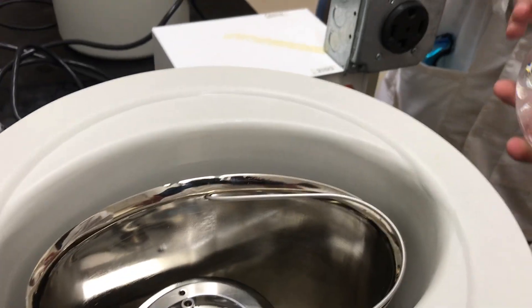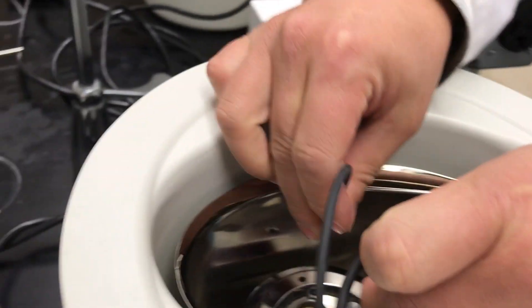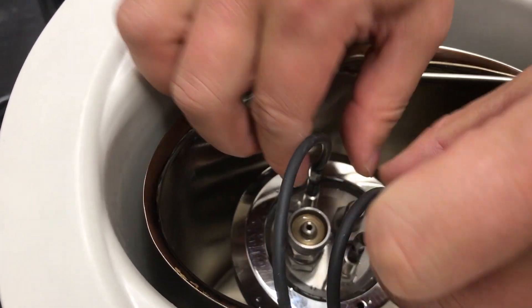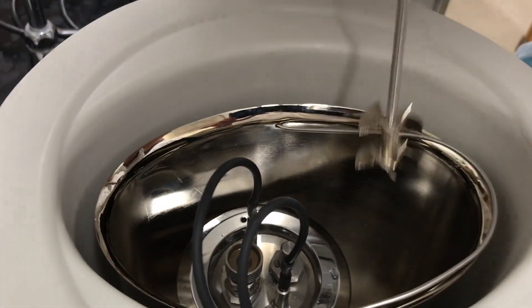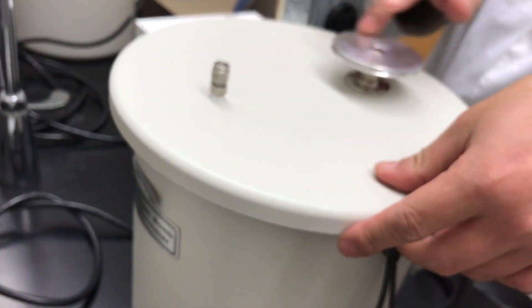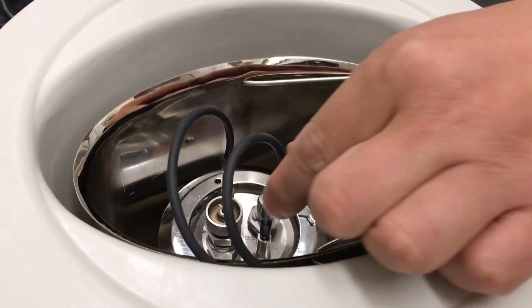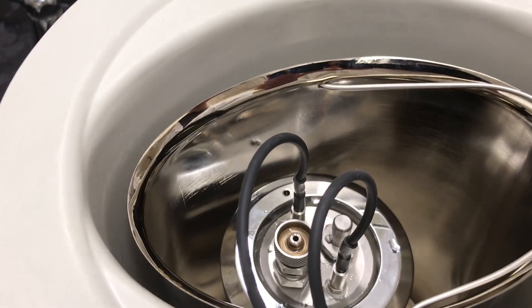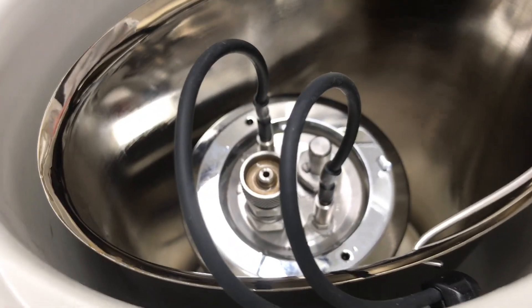Fill the reservoir with water. Our ignition wires can be a little loose, so we'll double-check them. Make sure the ignition wires are attached to the terminal on the bomb.